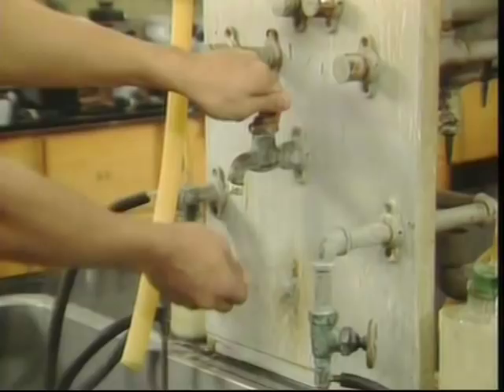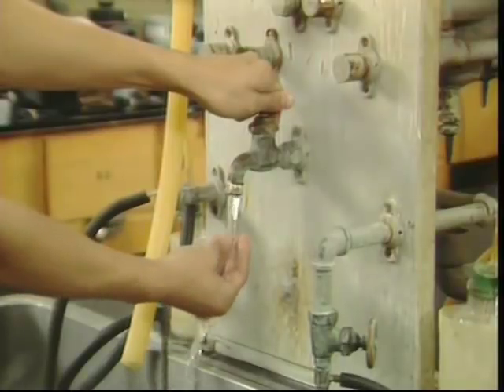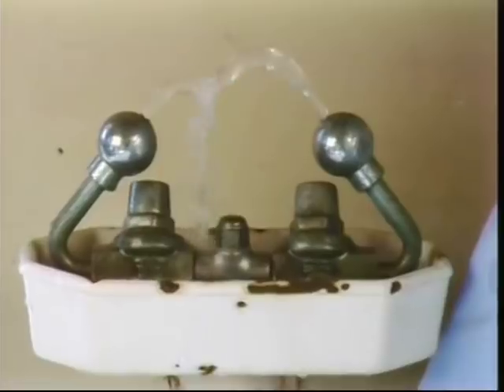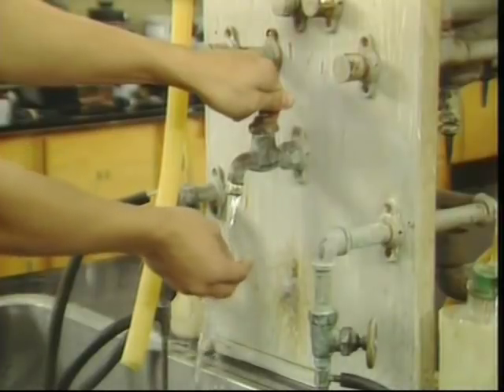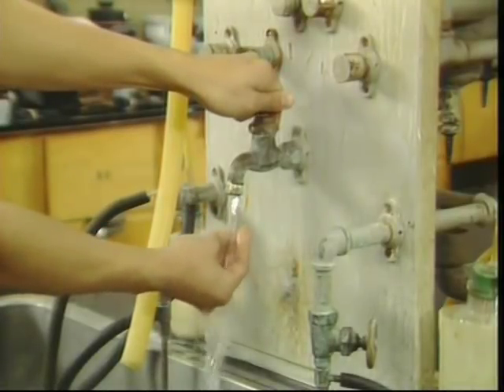When a large amount of chemical is spilled, remove the contaminated clothing and get under the shower and stay there for 15 minutes. For small chemical spills, wash the affected area under a faucet for 15 minutes. When any chemical gets in your eye, immediately get to the eye wash and wash the eye for 15 minutes. Then seek medical assistance. For small burns, use cold water or ice. For large ones, get medical attention.